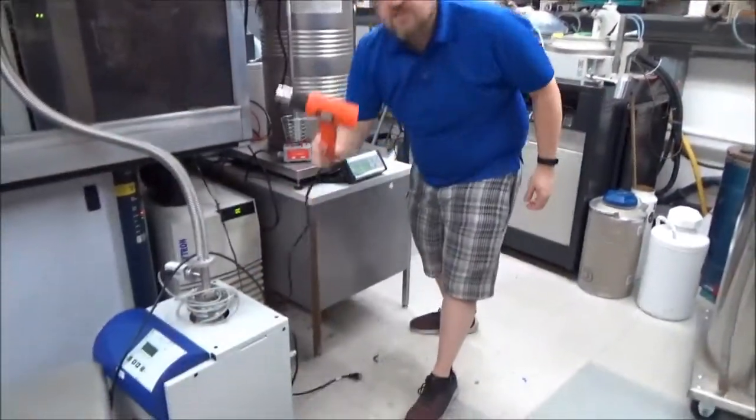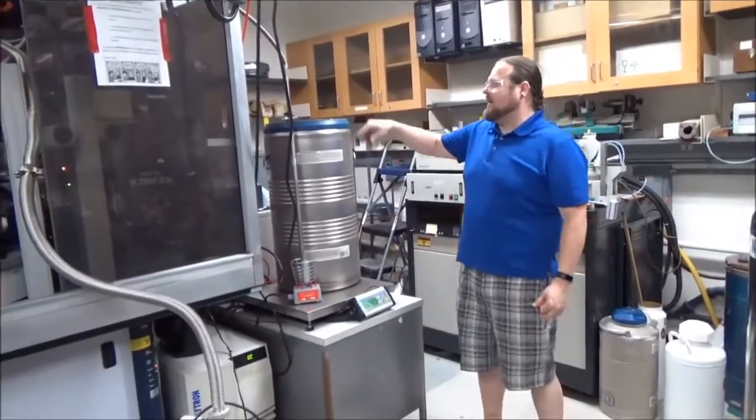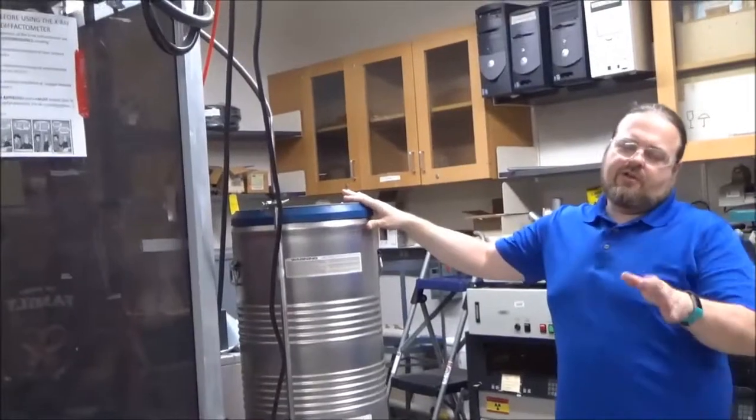Okay, so we used a heat gun to very gently heat up the transfer leg and got this out of the dewar, no problem.